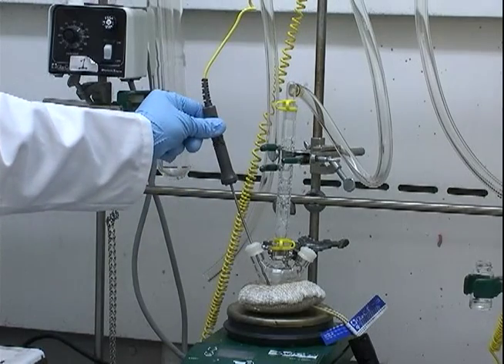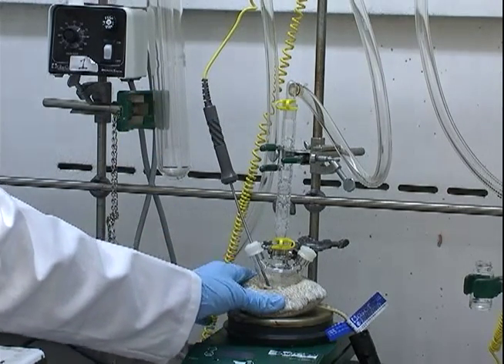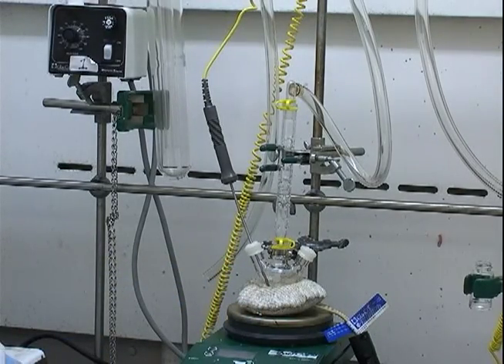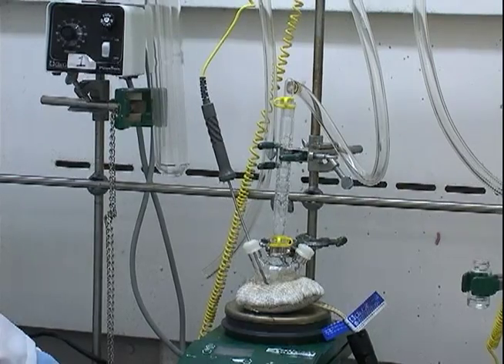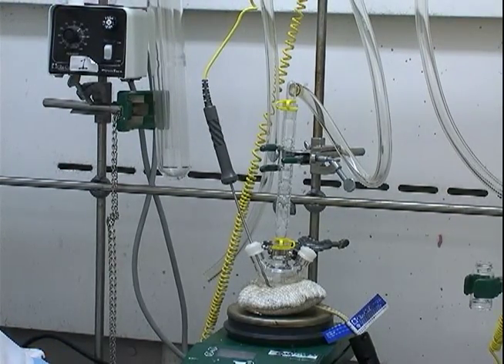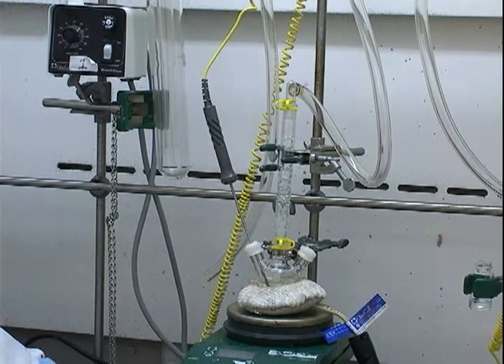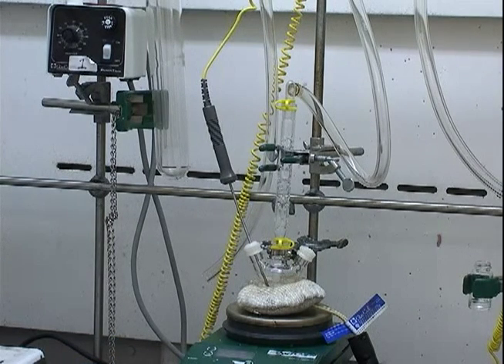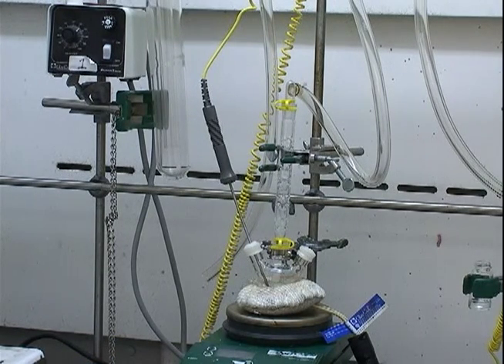On the other side we have a thermocouple to monitor the temperature of our solution, and we're using a heating mantle to provide heat, which runs through a temperature control box. The first two components we add are cadmium oxide and oleic acid, which we then heat to 200 degrees in a non-coordinating solvent, octadecene, and that allows the reaction to form cadmium oleate, which is our cadmium precursor.